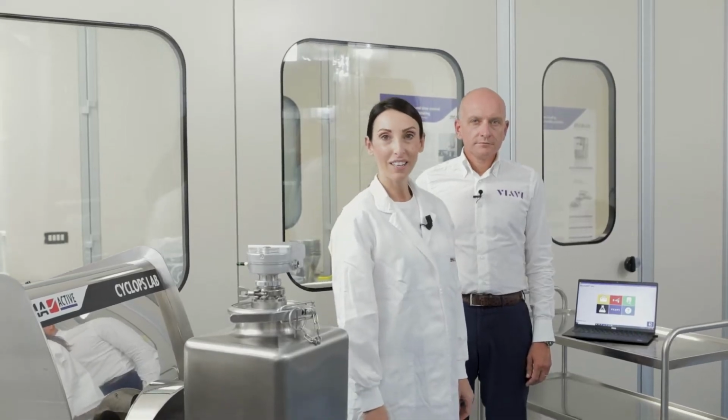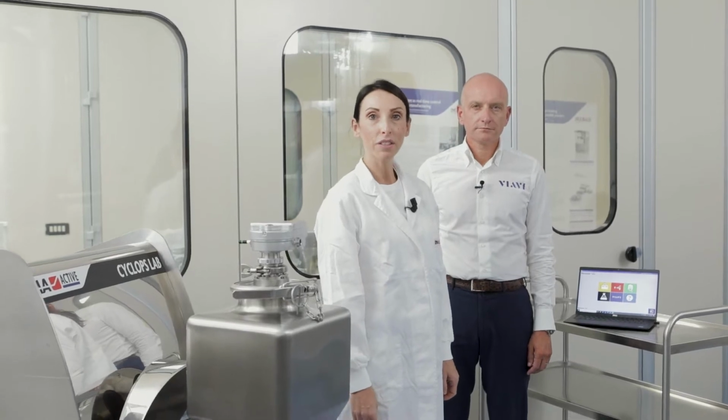Our main goal today is to show you a useful method to monitor and verify the blend uniformity on a binary mixture of powdered components. Before going deeply into the practice, I need to start by talking about the process analytical technology approach, which differs from the traditional approach of keeping the process as constant as possible, minimizing changes in the selection of powder material suppliers, process parameters, and method of analysis.